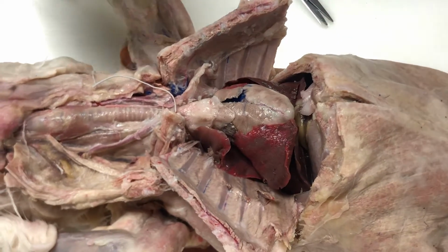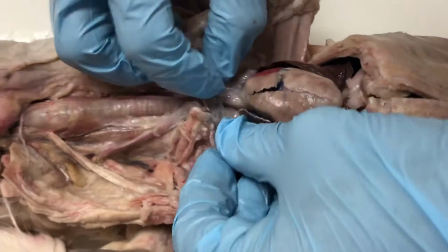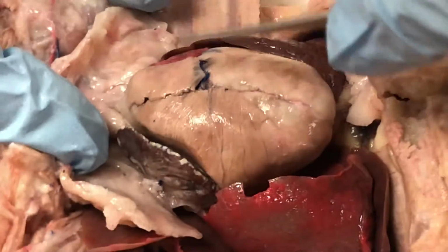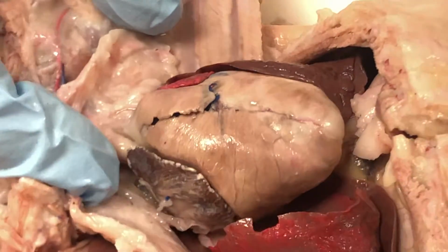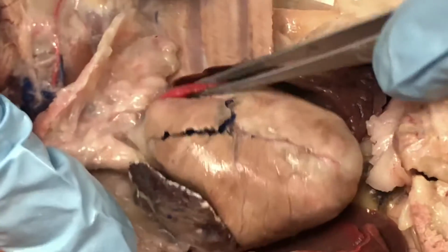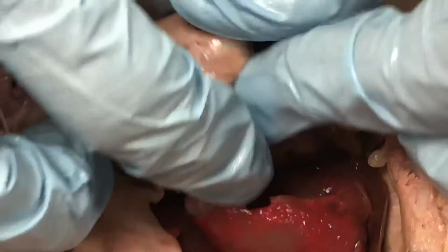Let's move to some of the different cardiovascular structures I want you to identify now. Of course, let's pull apart the thymus a little bit here and look at the heart. So one thing I want you guys to notice are the auricles. Remember, those are the external flaps of the atria of the heart. So here we have the right auricle, and here we have the left auricle. Notice the coloration difference. This is a much darker color. This is a much brighter red color because of all that oxygenated blood that's coming back from the lungs into the left atrium.